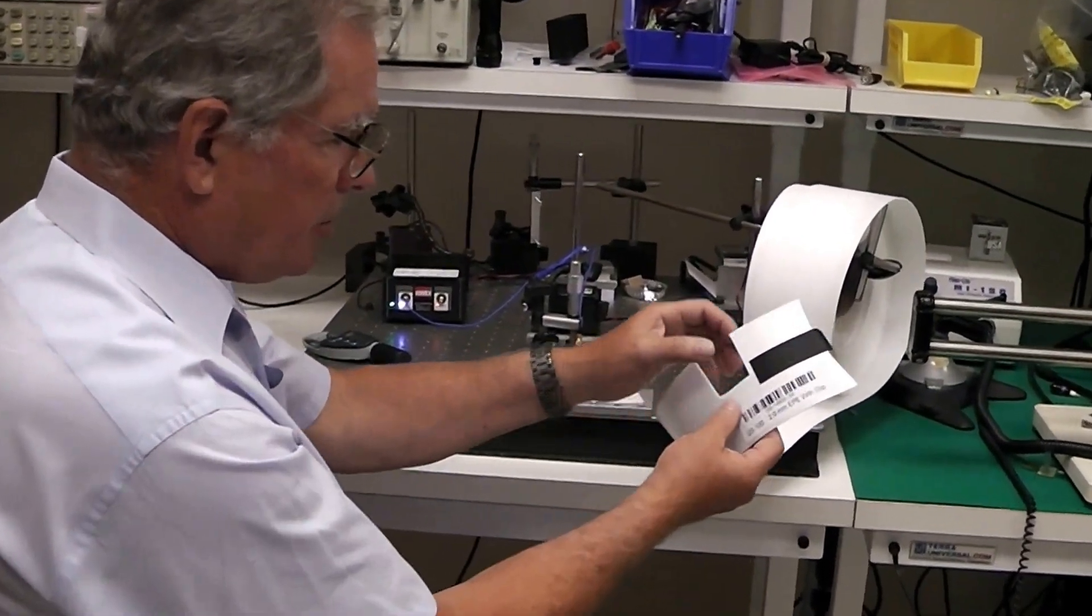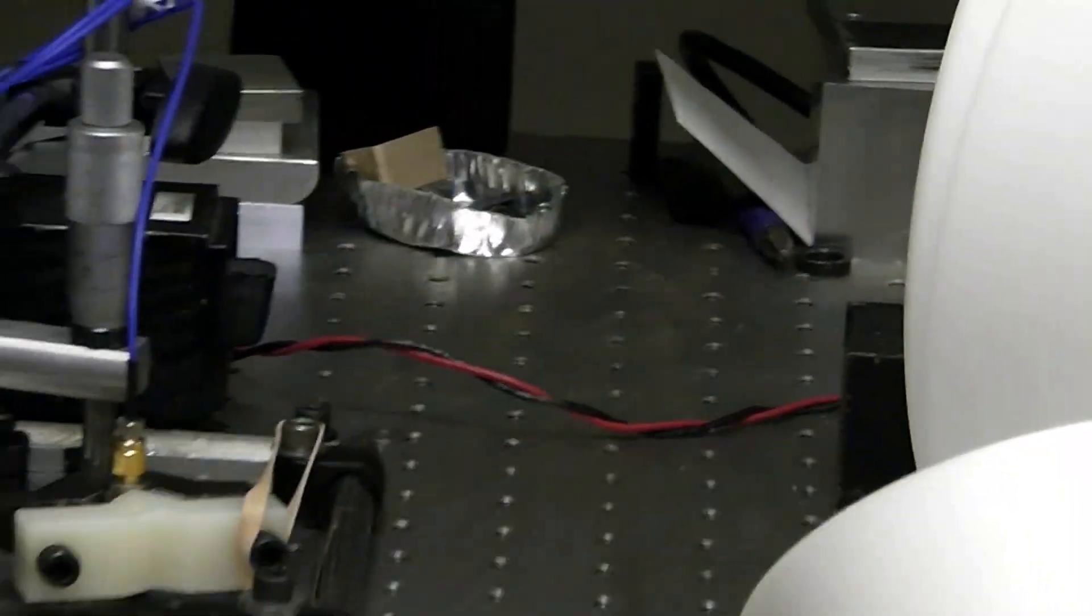Alright, in order to do a calibration, what I do is I take a sample out of this roll here.